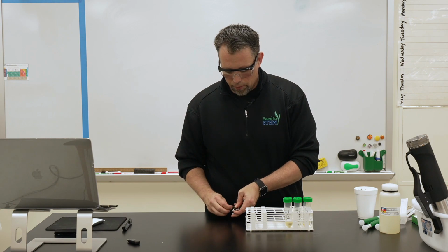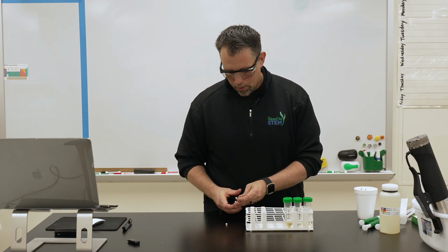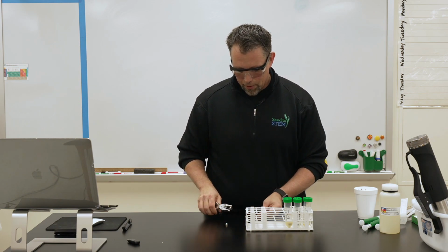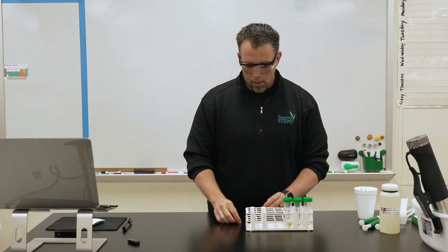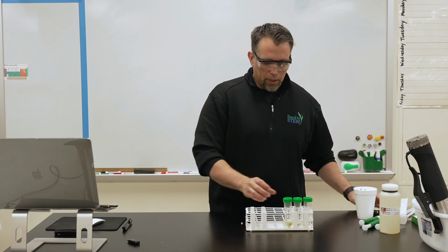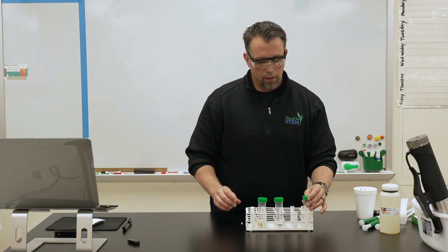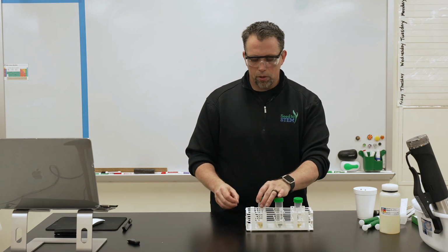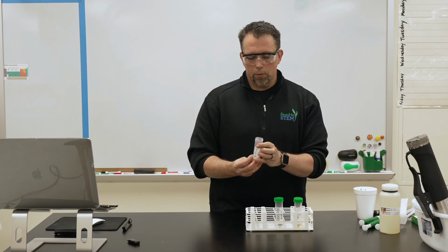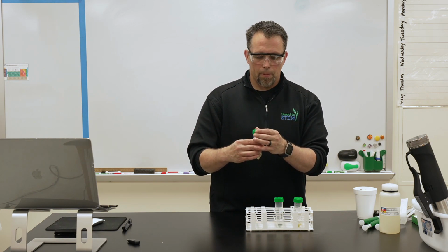And you should get 3 fairly identical styrofoam discs. And we have our 3 fuels, biodiesel, renewable diesel, and corn oil here. And just to compare what happens to the styrofoam disc in each sample.